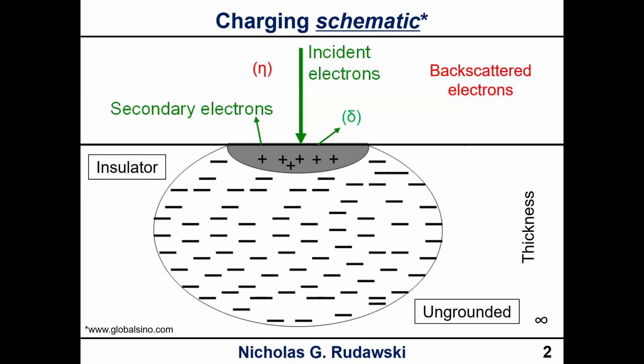So this is a schematic of the charging process. We have a sample that is an insulator, which is not grounded, and it is infinitely thick, from the surface into the bulk. When I shoot my beam of electrons at the sample, there are a few things that can happen. My electrons can be backscattered, so they can actually leave the sample.